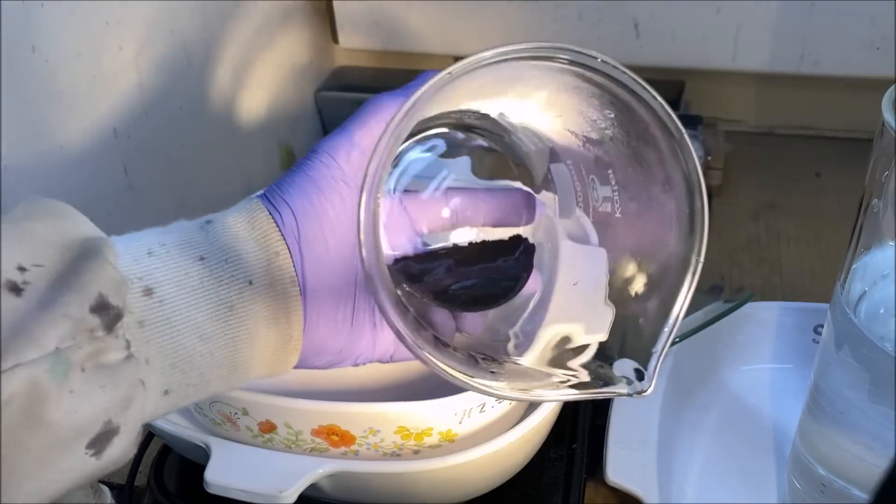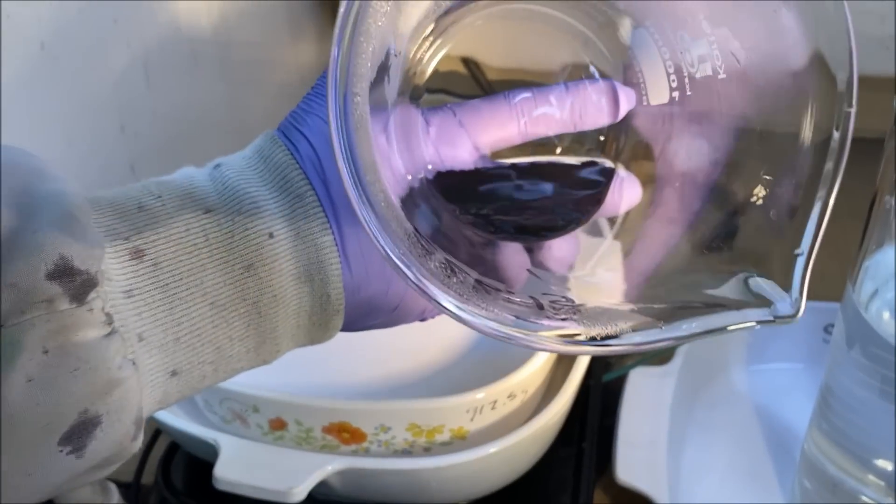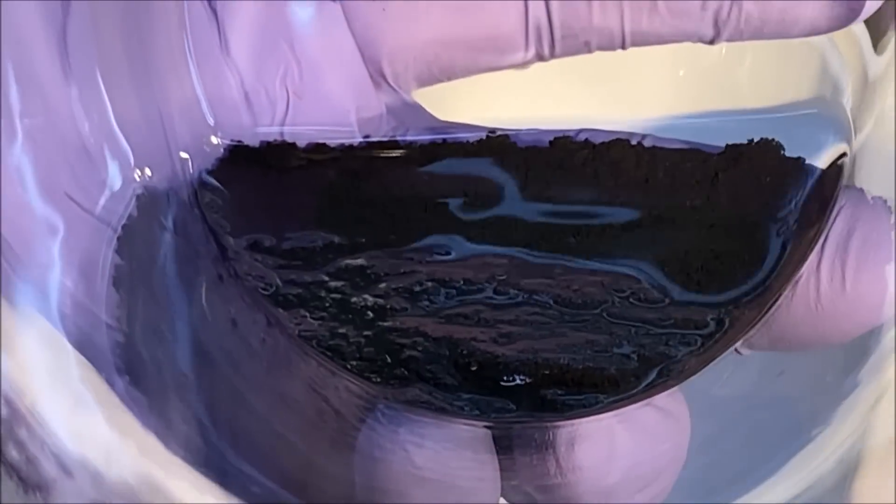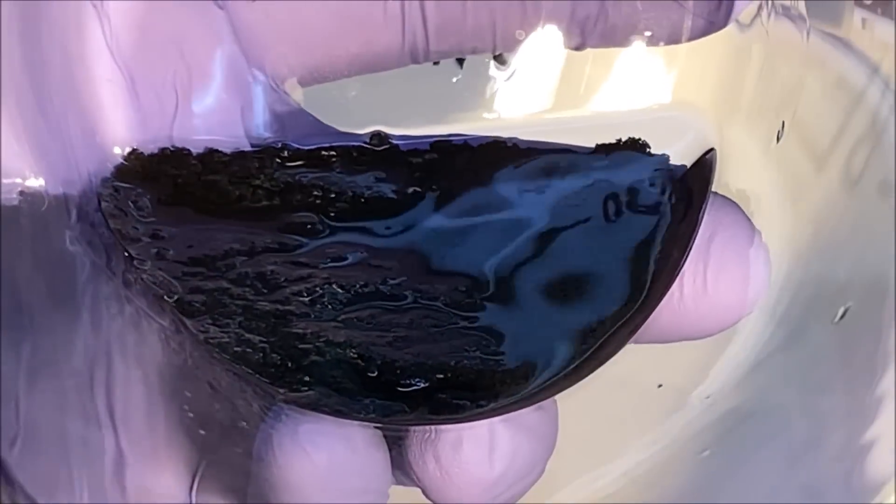Here's a look at the metal down in there. I don't know if you can see it real good or not. Lots of mixed black PGM powders.